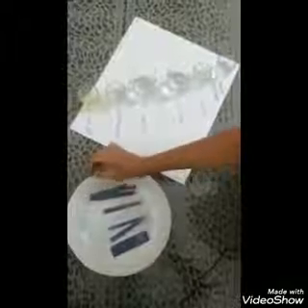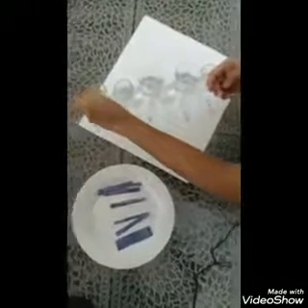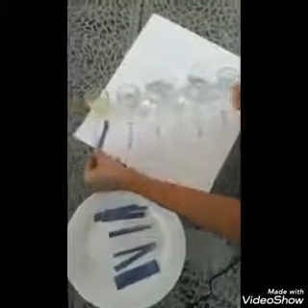Take a strip and dip it in the lemon juice — you can see that the color is changing. Take another strip and dip it in vinegar — you can see that both colors are almost the same.